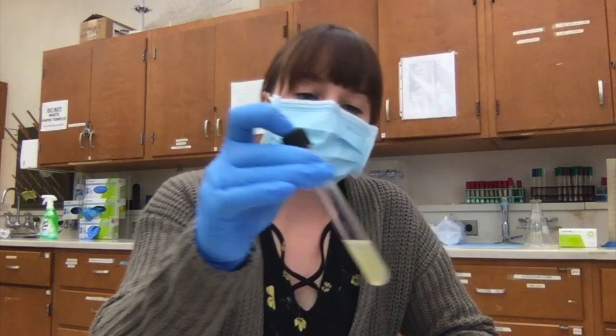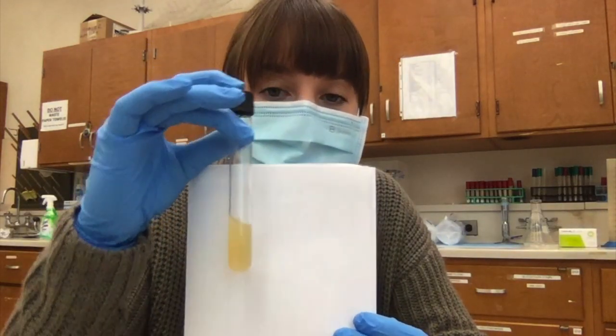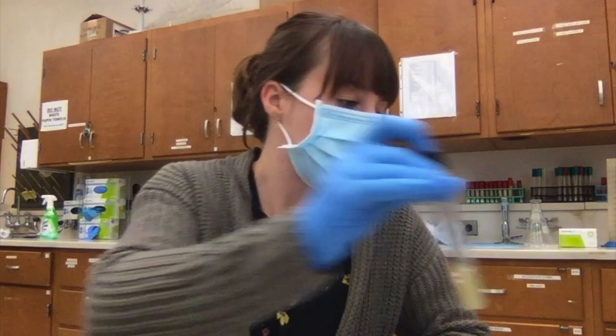We also have a slant here that is not slanted enough, and it almost just looks like media that was just poured and not slanted. This would not be good for inoculating with your organism.